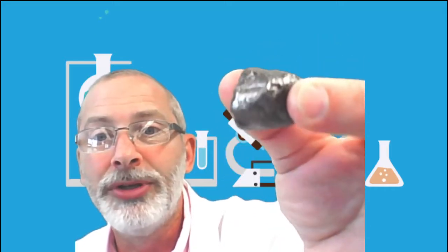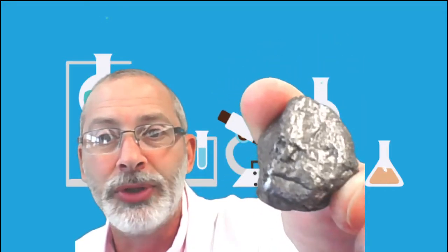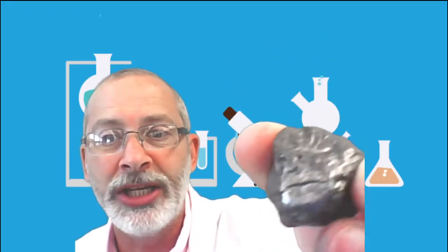Number 2, as soon as I get it out of the container, here we go. Here is mineral number 2, and absolutely, it's got a metallic sheen. You can actually scratch it with your fingernail as well, but the big hint here is to check the streak. I don't even need a streak plate for this one.